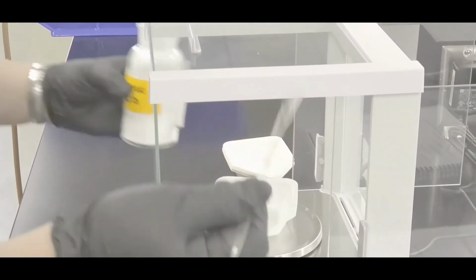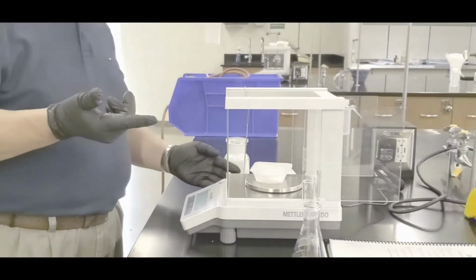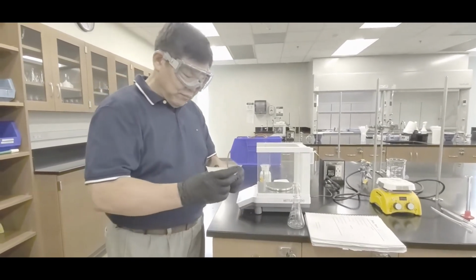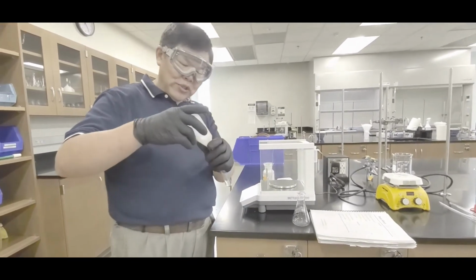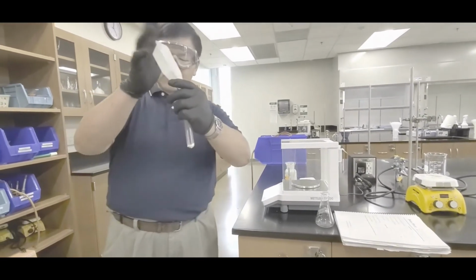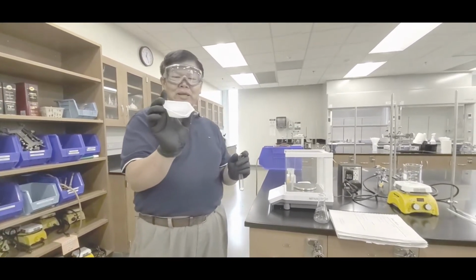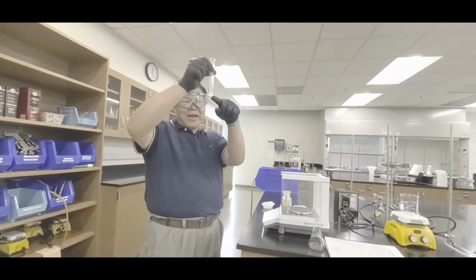Okay, that's pretty good. However, do not take that number, okay? So you're estimating this much. So what you then do is take that guy out. It's a good habit to close it. And then shake it, and here's a test tube. Put the spout right there and shake the powder in, okay? Try to get as much as you can, okay? Now you notice that there's some powder that's stuck right there. That's why I did not record that number, okay? So, what's important is what's in here. So it should be about like that.